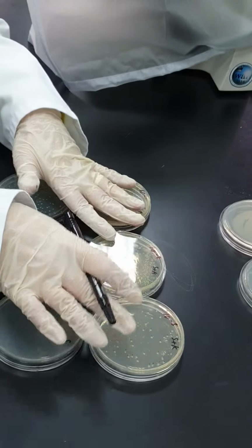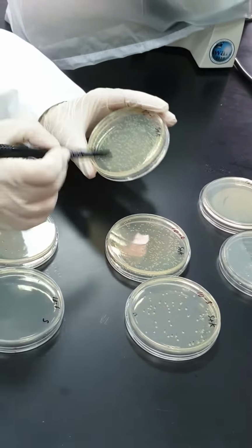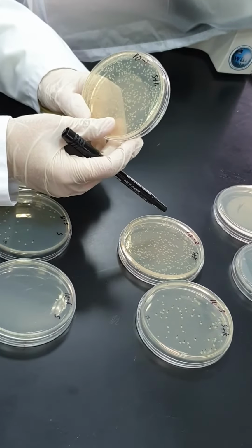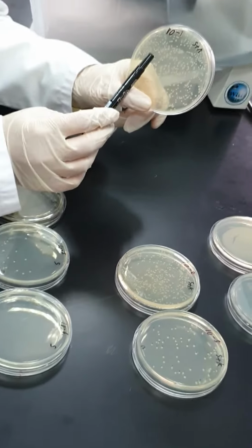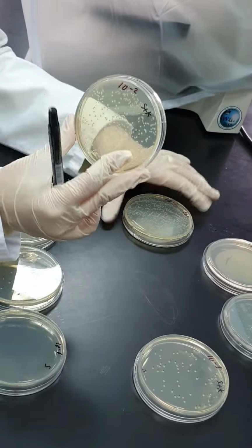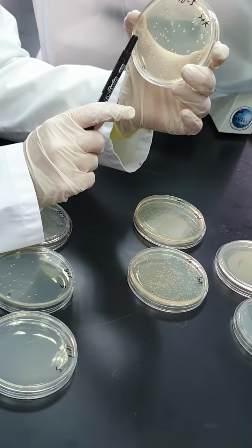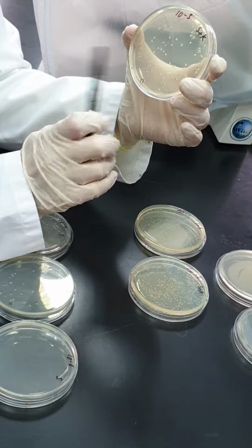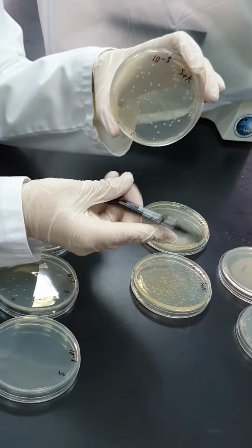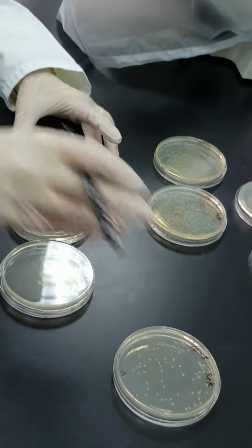Now we come to the results of the transconjugants. Tube number 3, the different dilutions, the colonies that have grown on streptomycin plus kanamycin. This is the 10 to the power minus 1 dilution, I have heavy growth. 10 to the power minus 2, I have less growth. 10 to the power minus 3, I have a perfect colony petri dish to be counted. So these 3 petri dishes show the transconjugants, and this is the best to be counted. So I will keep it aside and I will count it.